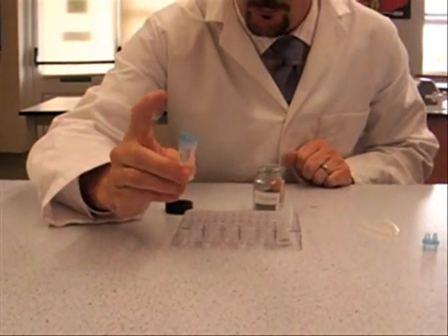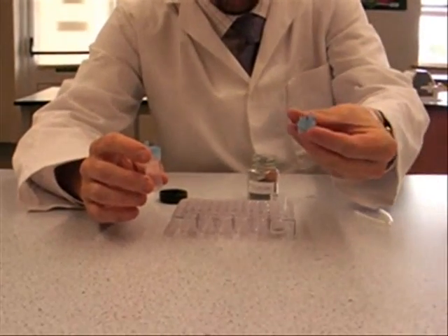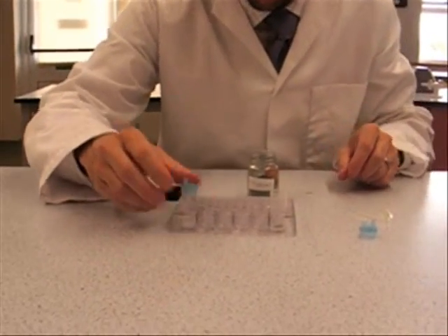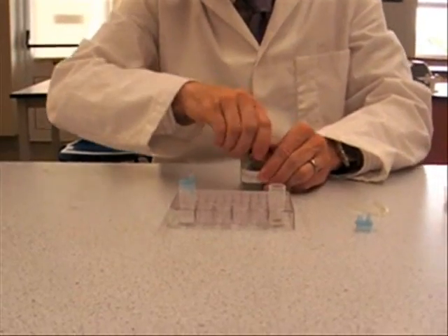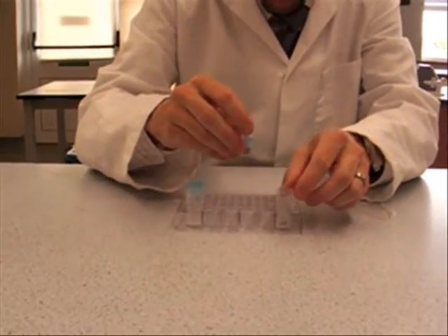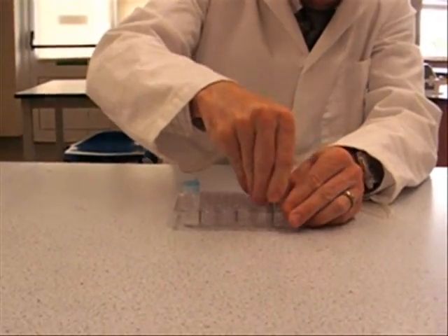And the difference is, this is the one with only one bit sticking out, whereas the other blue lid's got two bits sticking out. And that goes in there. On this lid, we're going to pop that blue top. Make sure it's on firmly.